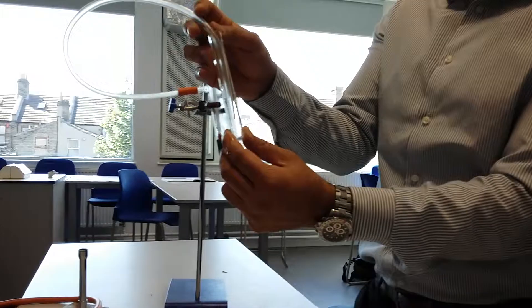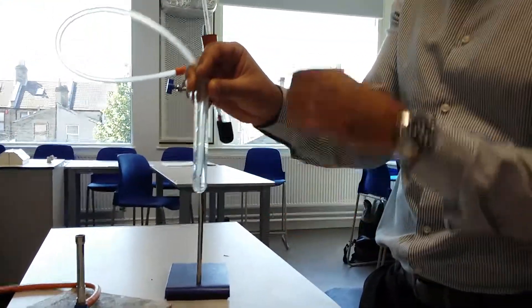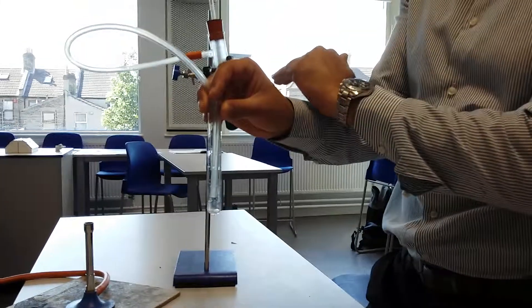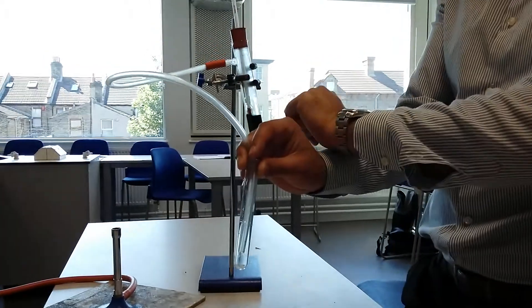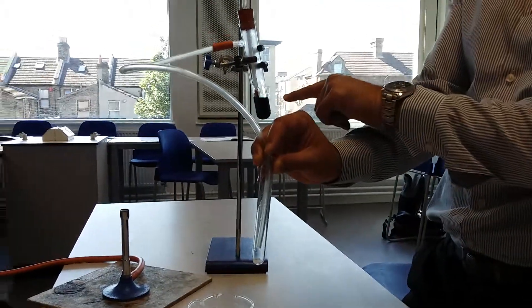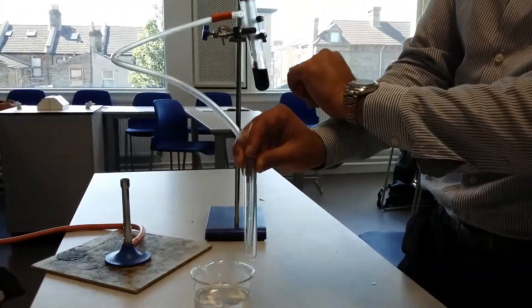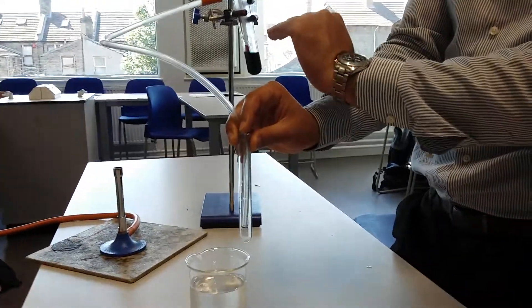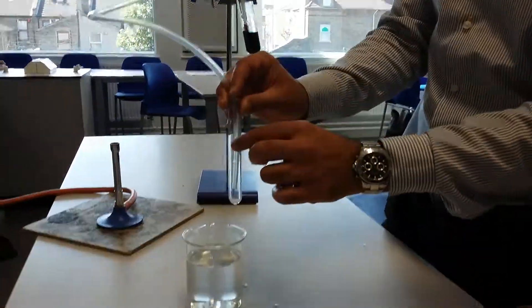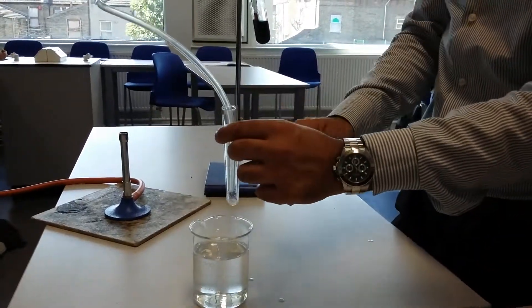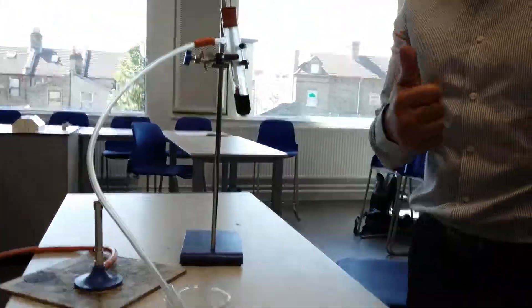So I've got nothing in here, in this test tube, so it's going to start collecting in here. So we can use different temperatures to boil it and take out different parts of the crude oil. So our different alkanes, all the different hydrocarbons that we're interested in, they all boil at different temperatures. So if I can maintain those different temperatures, I will get them separating out into my test tube and we'll collect them into different test tubes. So you guys go ahead and try that now.